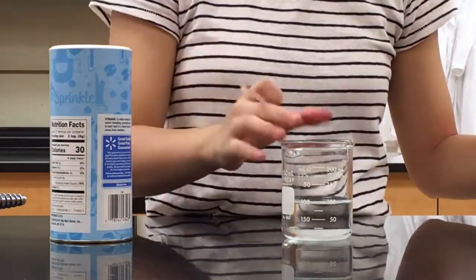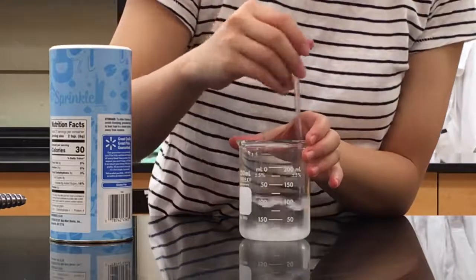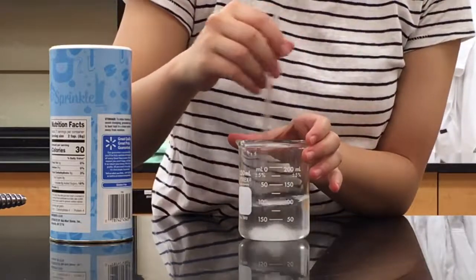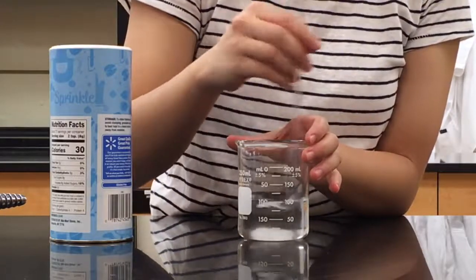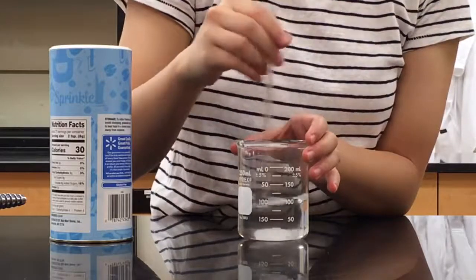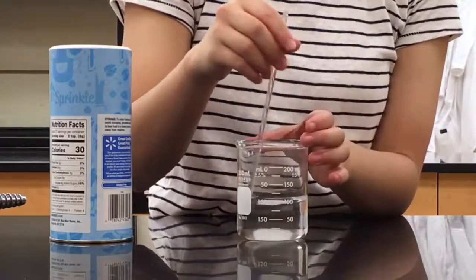And then you'll see that they sink to the bottom. Once you start with the glass stirring rod, you see that the sugar crystals disappear but the level of the water remains unchanged. So as you may know, matter is made up of small particles called atoms.